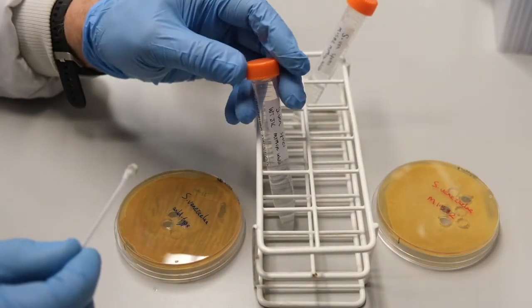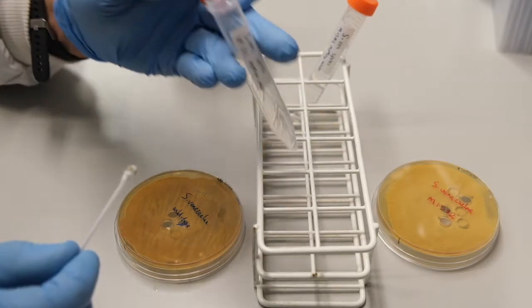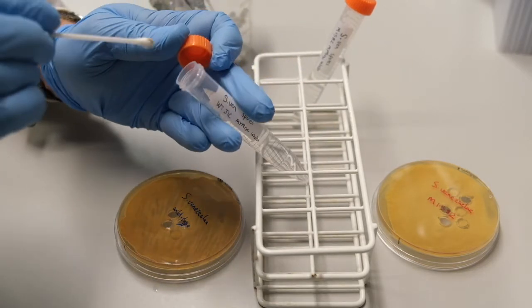The spores are washed off the cotton bud by dipping into our solution of 20% glycerol.